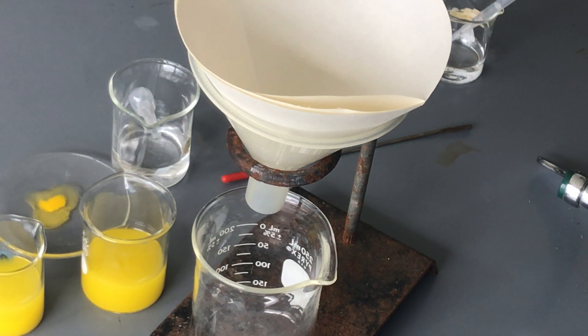Okay, so in this video we're actually going to go through one of the processes of separating a mixture, and that is of course one of the basic ones of filtration. So I just have a very simple setup.